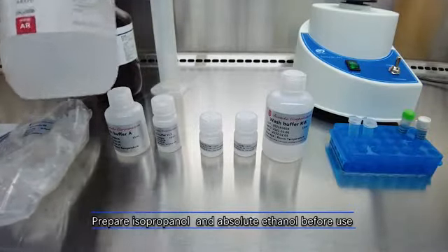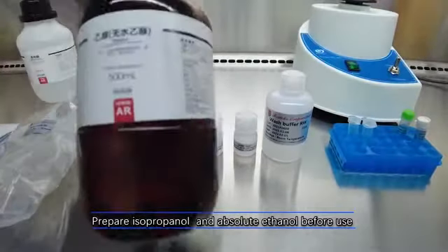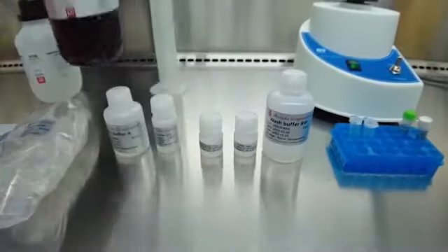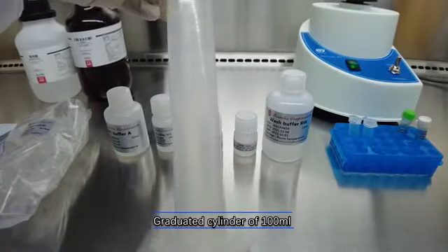Prepare isopropanol and absolute ethanol before use. You'll need a graduated cylinder of 100 ml.